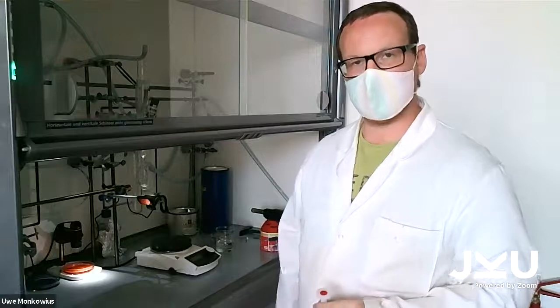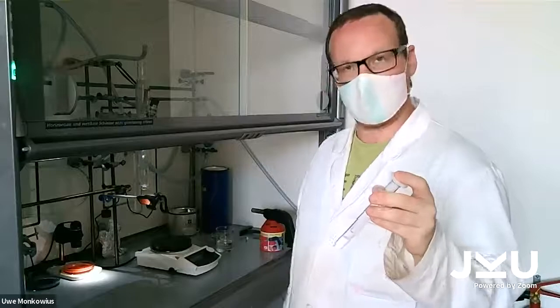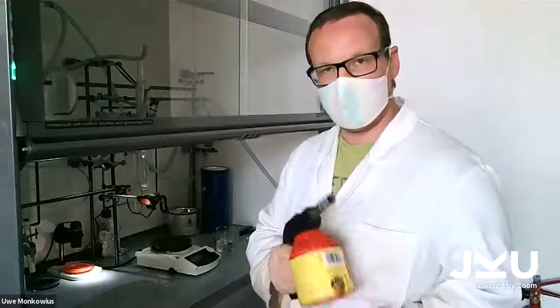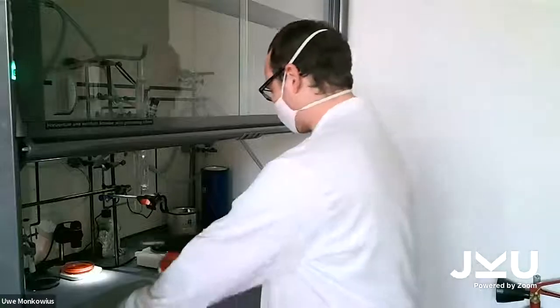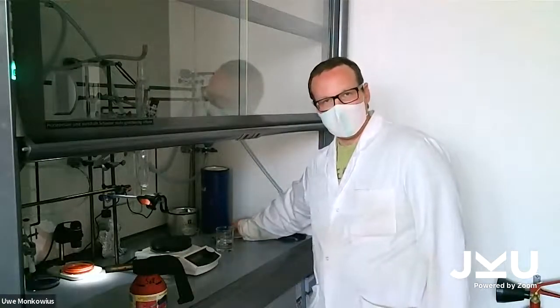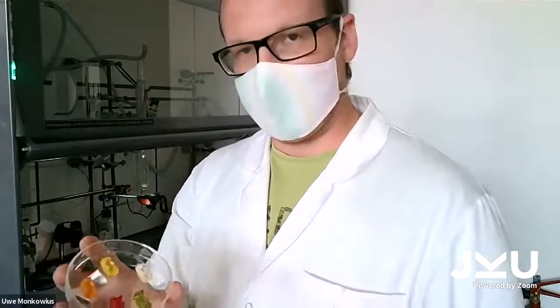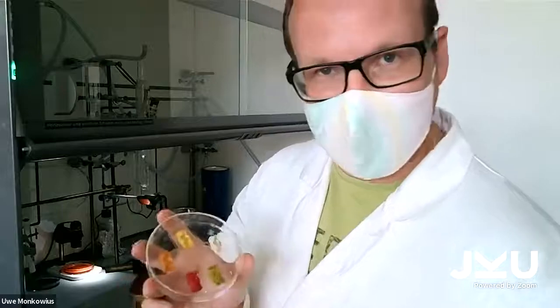So for the next experiment, I need three things. A test tube with some potassium chlorate, a blowtorch to melt the potassium chlorate with the lighter, and again, some gummy bears. We just need one gummy bear, and I prepared one gummy bear in almost every color, and you, the people online, can decide which gummy bear I will choose, which gummy bear will be sacrificed to the chemistry god.